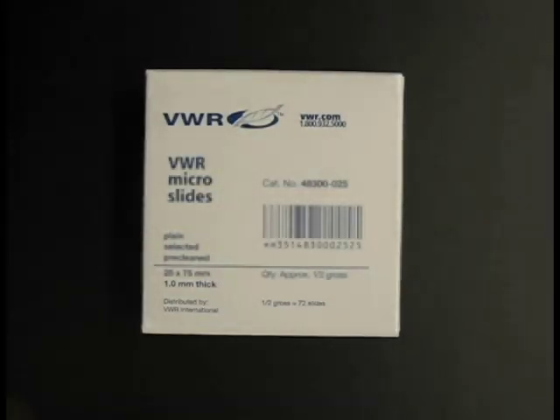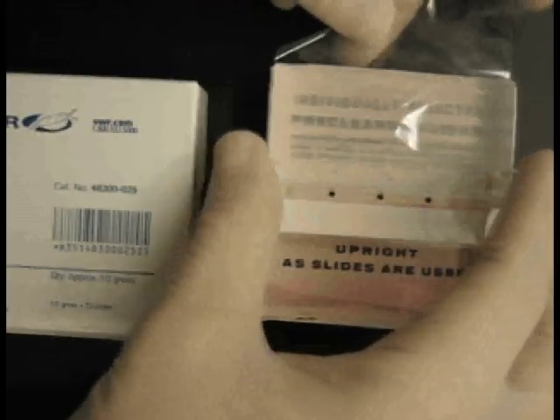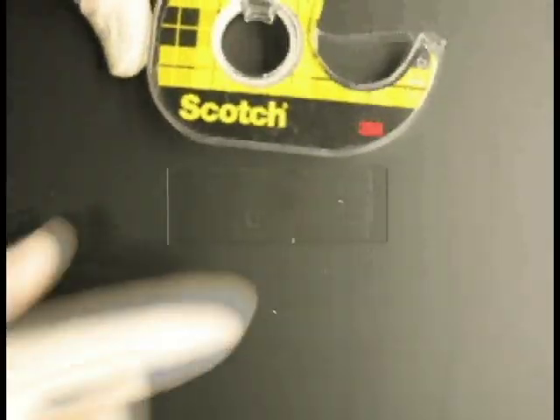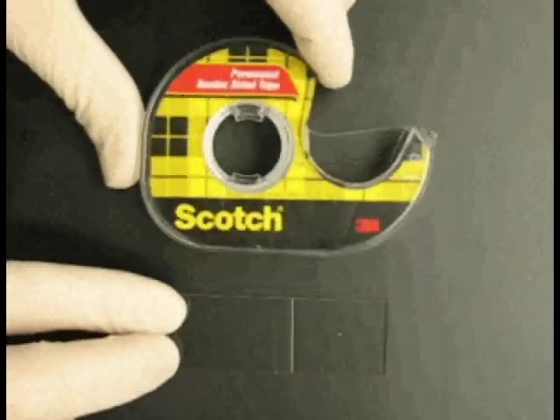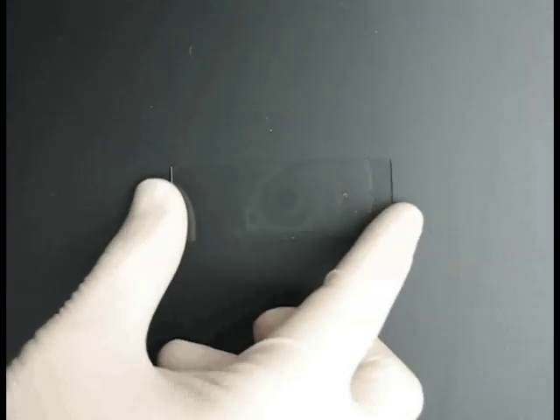To prepare a flow cell for use with the gliding motility assay, you first need a slide. KochLab likes to use micro slides from VWR. You can clean your slides by any method you choose. Piranha, Alconox, Windex, or sonication all work fine. I don't clean my slides or slips, but I do make sure that we purchase the quote-unquote pre-cleaned slides.